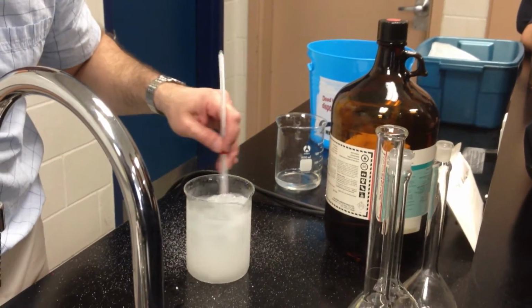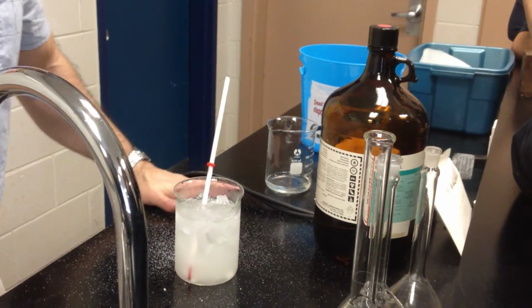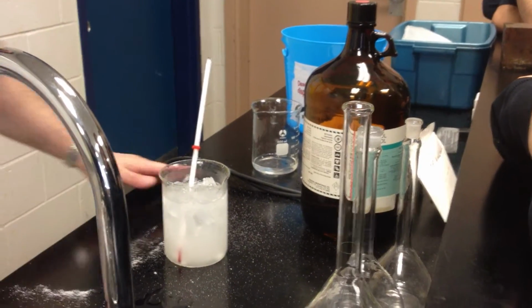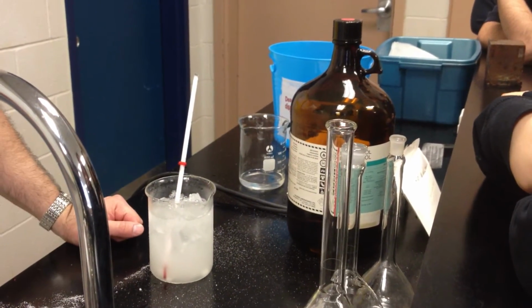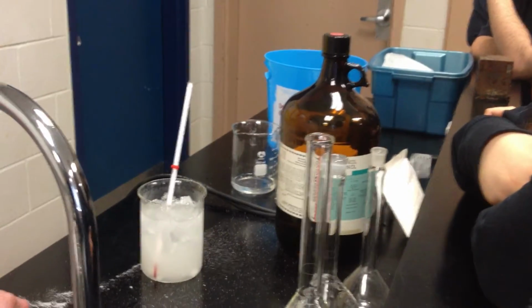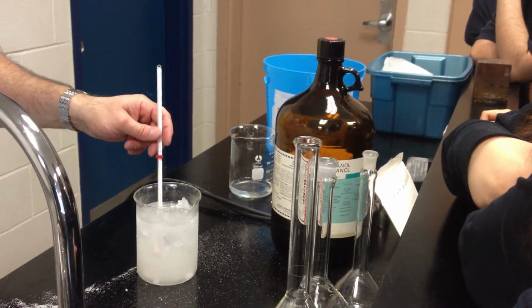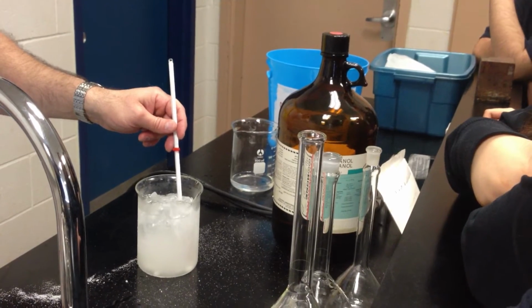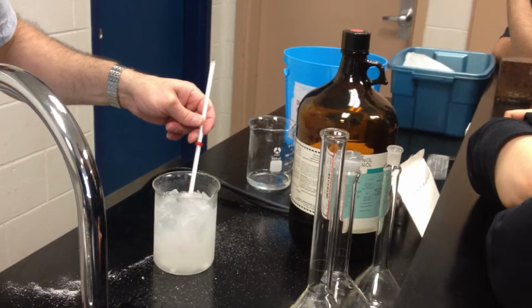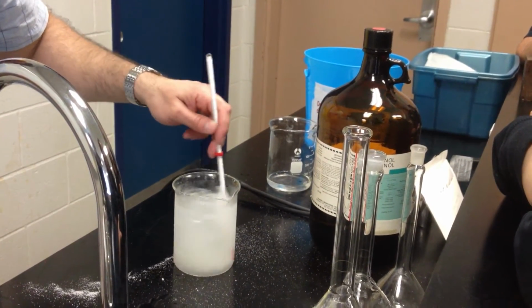As more and more of the salt dissolves, what's happening is as the sodium chloride breaks down, there's a certain amount of energy needed to break down the lattice of the sodium chloride. That energy is being robbed from the water. It's an endothermic process, and because the salt is immersed in a solution of water, the heat energy ends up coming from the water, which ends up being chilled. So we see the temperature has already dropped to minus 6 or minus 5.5. We'll just keep on stirring, see just how low we can get it to go.